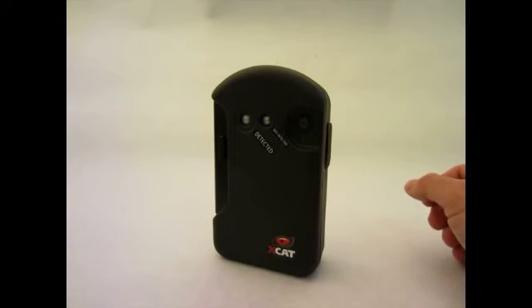When handling sample cards, do not touch the sample paper portion of the card with your hands to avoid contamination of your sample.